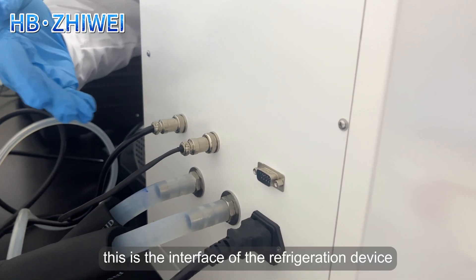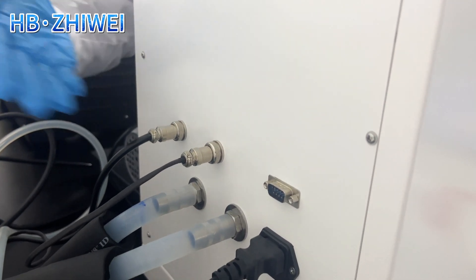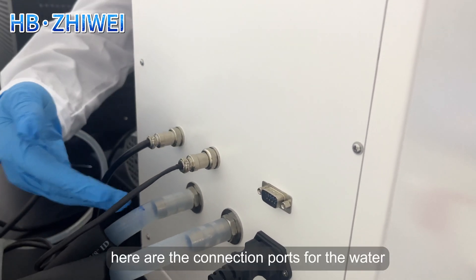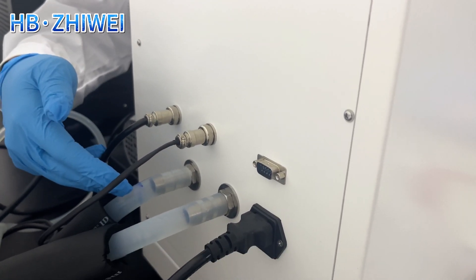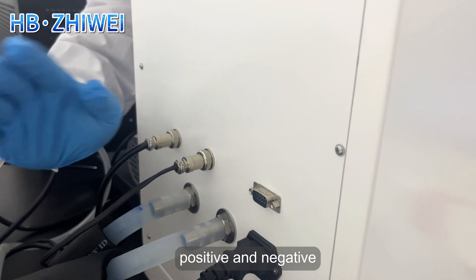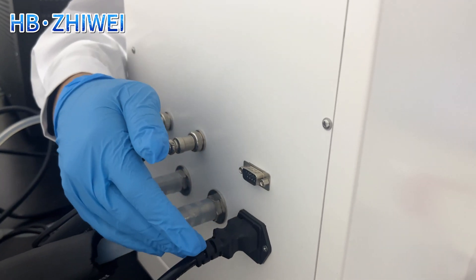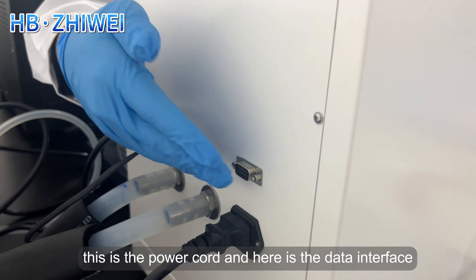This is the interface of the refrigeration device. Here are the connection ports for the water pipe and drain pipe on the refrigeration equipment. These two interfaces do not distinguish between positive and negative. This is the power cord and here is the data interface.